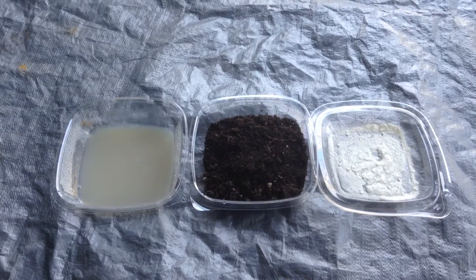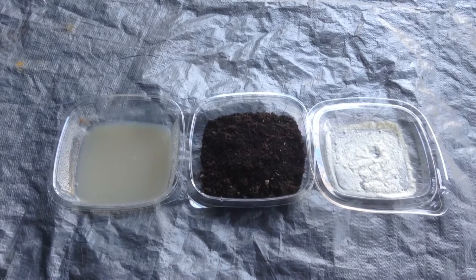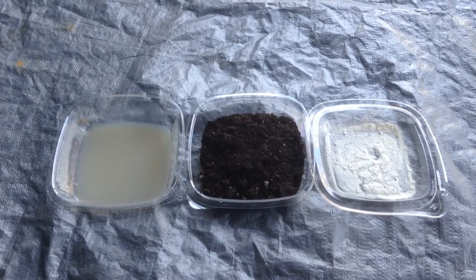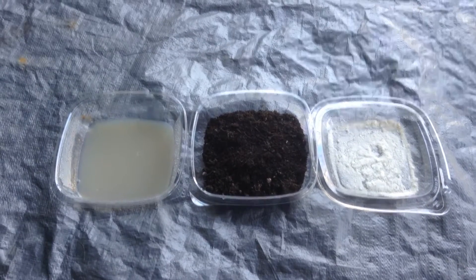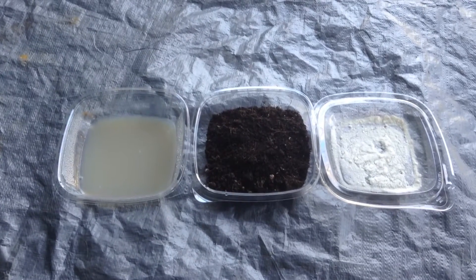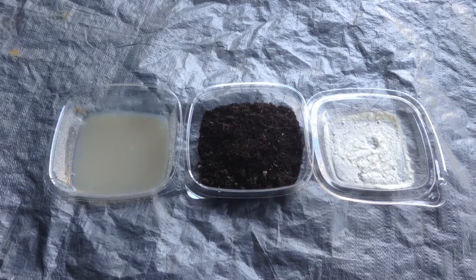He is a wonderful God. Sorry about the time delay between videos — it's been a while, but here I am to show you another experiment. The last experiment I did with mycorrhizal was sprinkling it on potato dextrose agar to see what would happen. That experiment got thrown away, so I am doing it again.